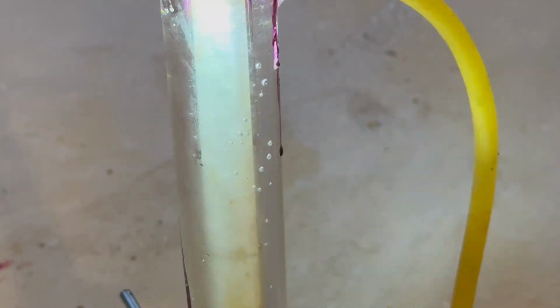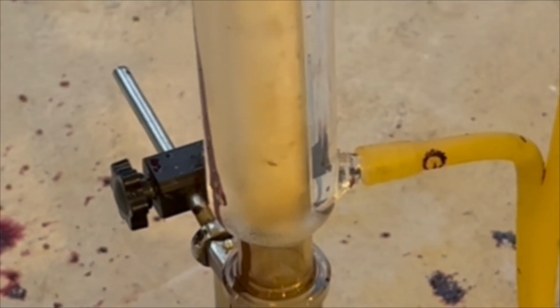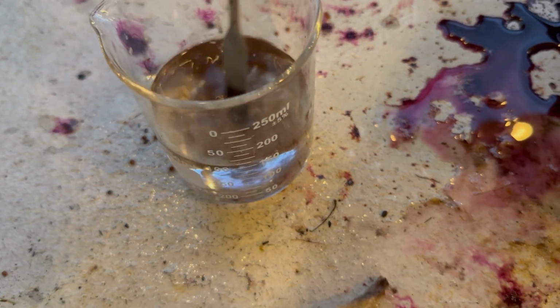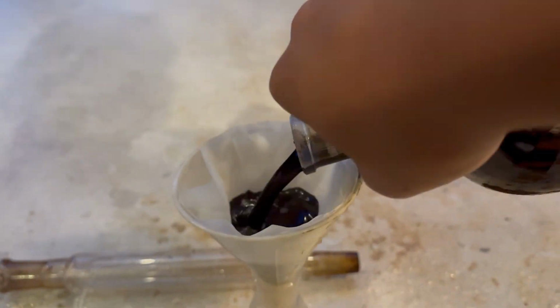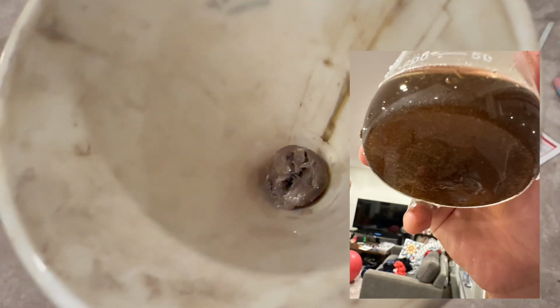And at the same time, all of my permanganate was consumed somehow, even though a good amount of naphthalene had clearly left the reaction. A good way to test for reaction completion is to add a small amount of the reaction mix into some water and see if it turns purple. I then filtered it, which greatly reduced its volume due to the massive amount of manganese dioxide stuck in the solution.